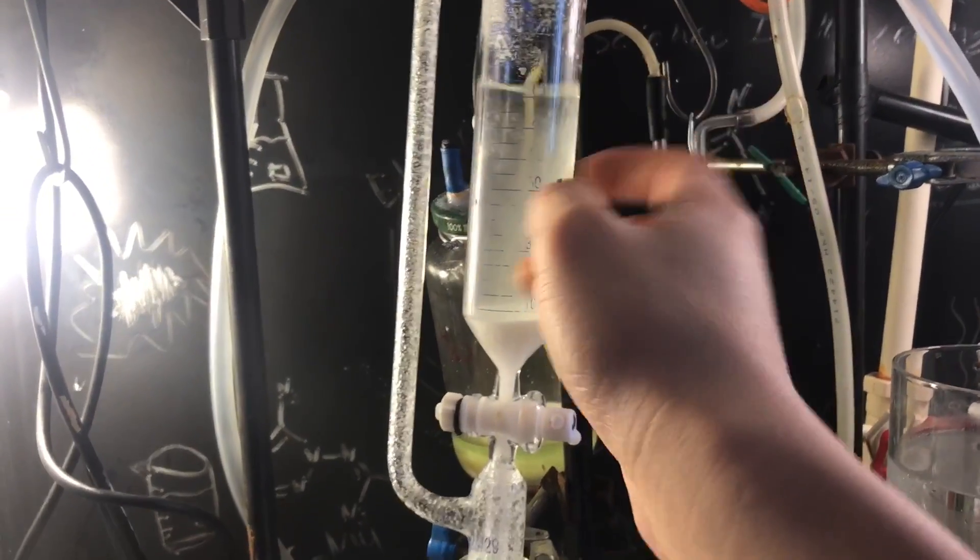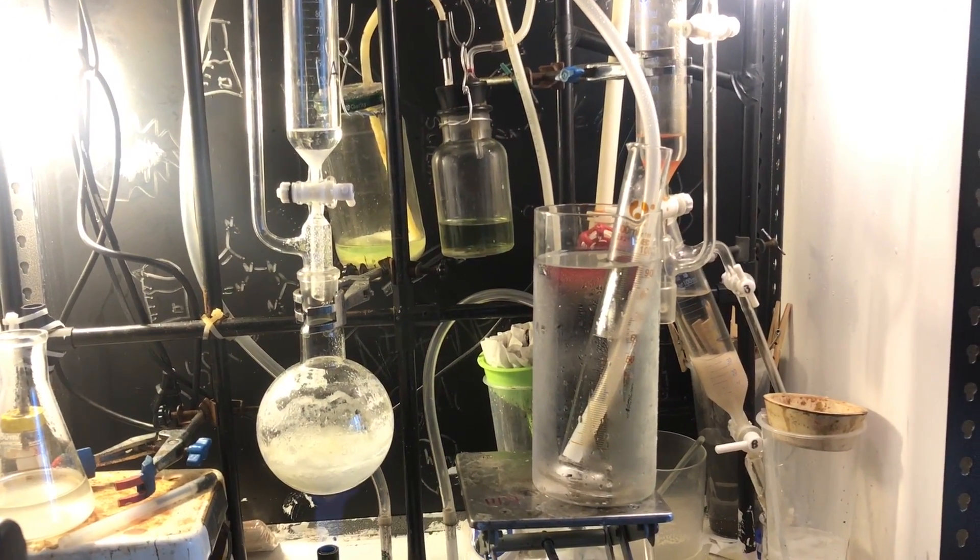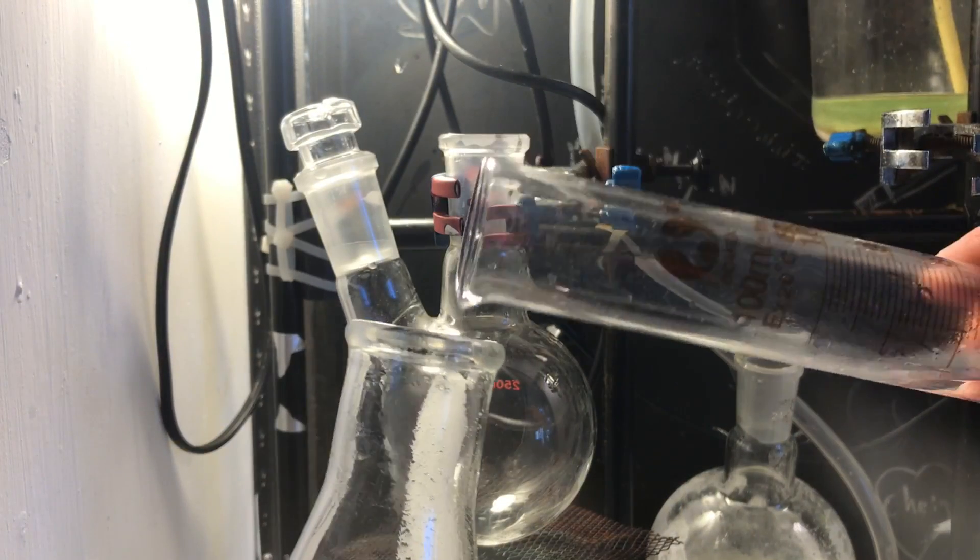Luckily, it's all captured in this addition funnel. However, we're gonna distill the hydrochloric acid anyway, so I'm just gonna continue generating more gas until it no longer generates anything.